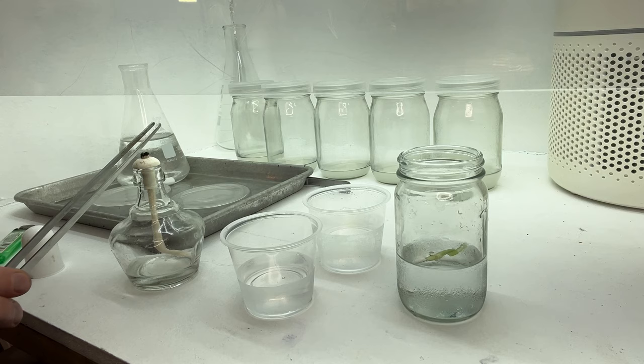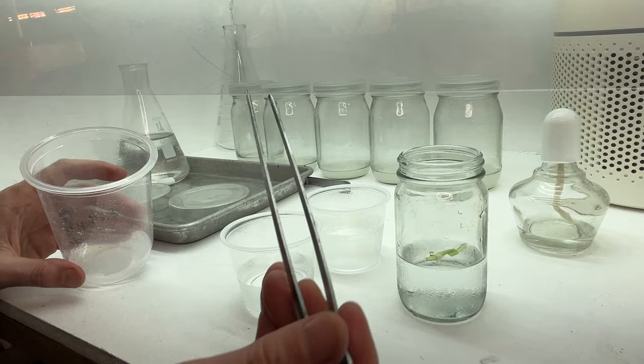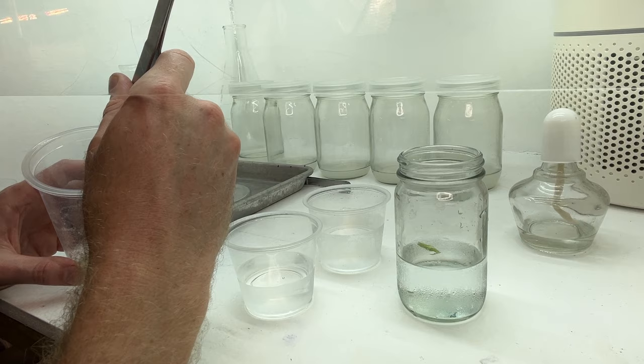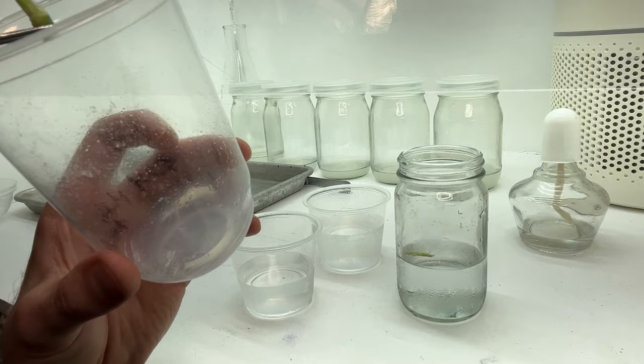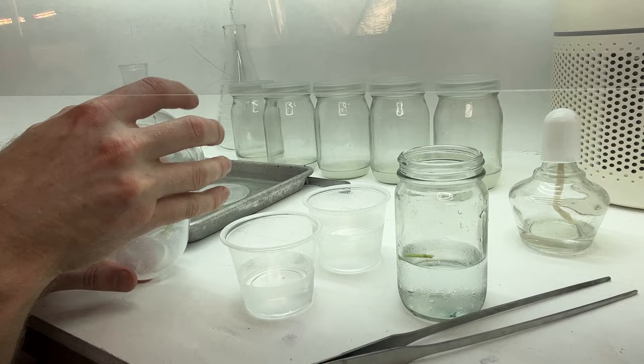In this batch of multiplication media, we have some nutrients as well as some growth hormones. We typically use BAP and NAA — a cytokinin as well as an auxin. Our process is to take the bottom side, which contains the root, and stick it down into the jelly, which has some agar in it to make it solid — just like that. And as quickly as you can, make sure to cap your vessel. Many times we will also use some saran wrap to wrap around the edge of it.